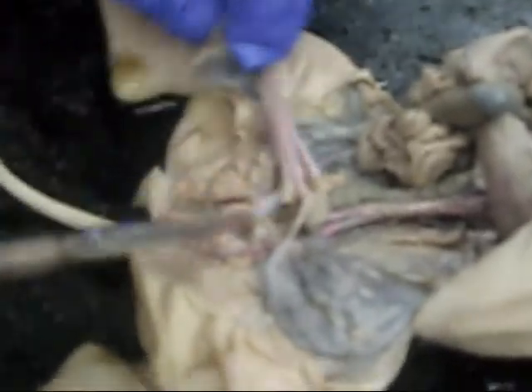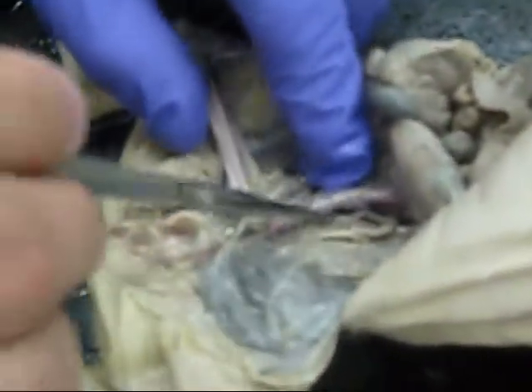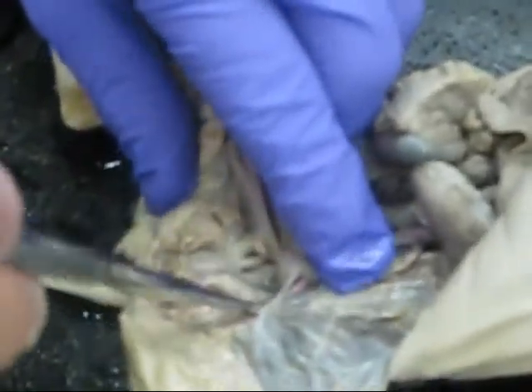And then the left external iliac vein. All I see is arteries down here. I don't see a vein. Probably got cut. I don't think it got dyed well because all the blue dye is up top. Yeah, I don't see it, but the veins are basically the same as the arteries, just underneath and blue. There we go. That finishes our examination. Cool.